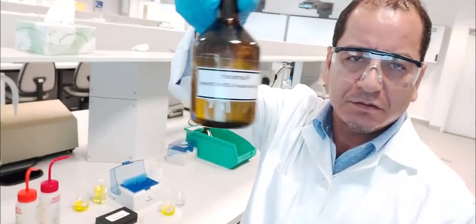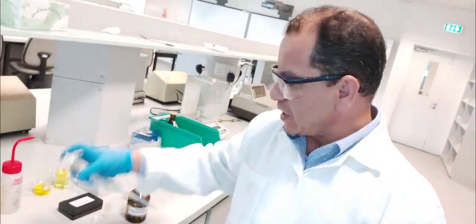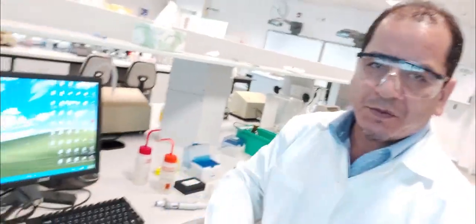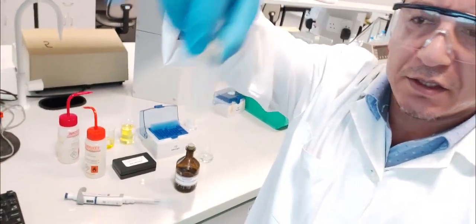Good morning everybody. We are now in the laboratory of analytical chemistry. We will measure the absorption spectra of some samples. For this we will need fluorescein, as you can see here. We will also need a micropipette to take the exact volume of the sample, then we need ethanol as solvent. To measure the absorption spectra we have the equipment Cary 50, where we will introduce our sample in the cuvette.